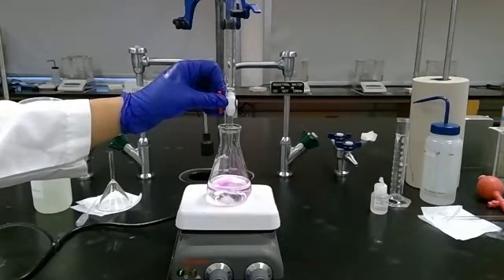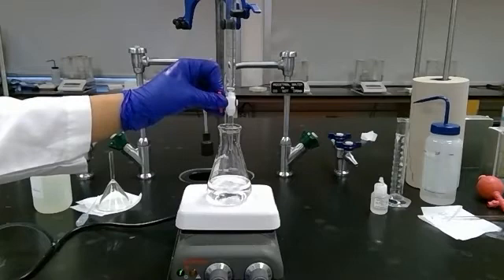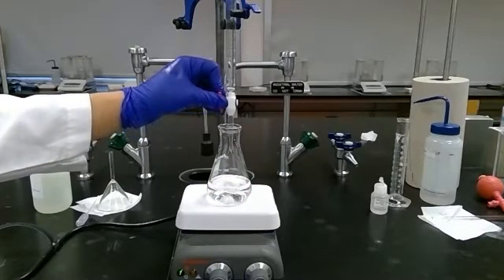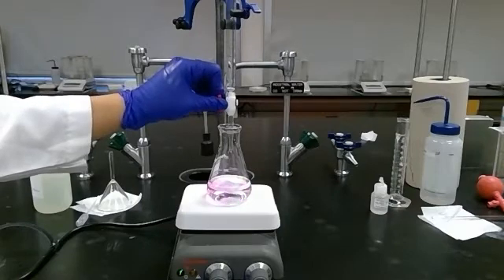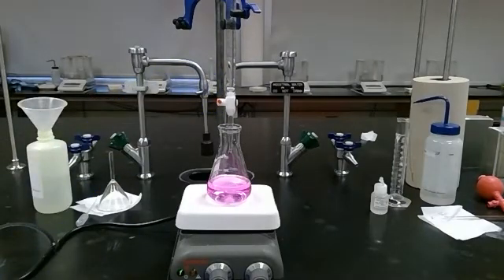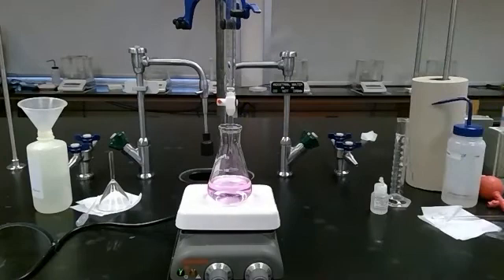Now it's hanging around quite a bit. I wonder if I stop. But it goes clear, so it's not sticking around. I'm going to slow down and go drop-wise. It's very close. There we go. You can see there's half a drop still hanging on, so I'm going to squirt that into my solution. I have a nice light pink color. Now I'm going to read where my burette is at.